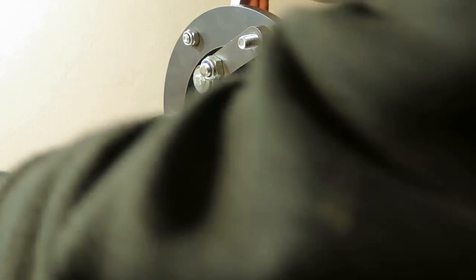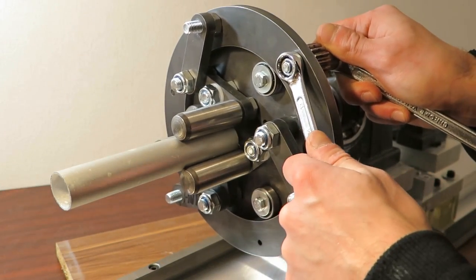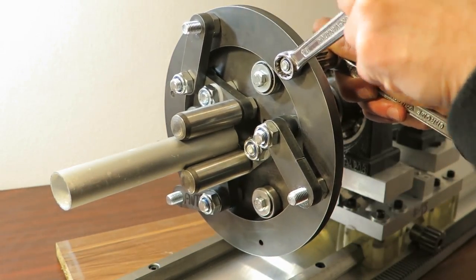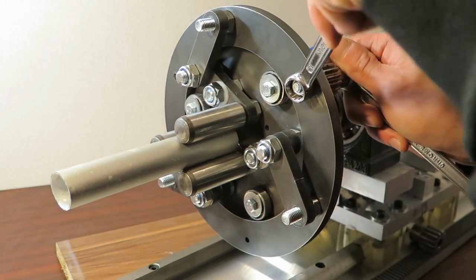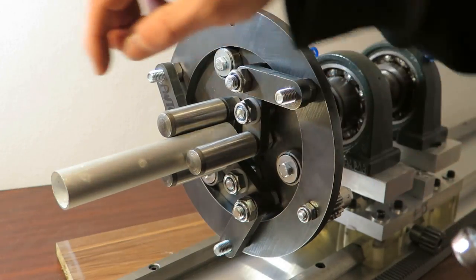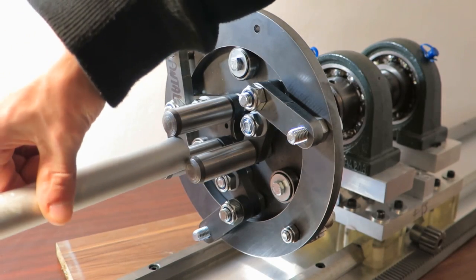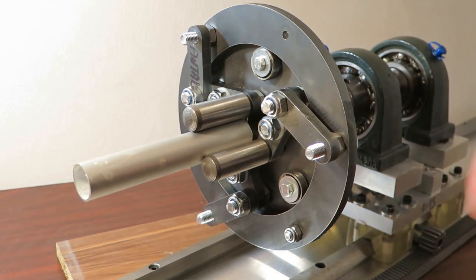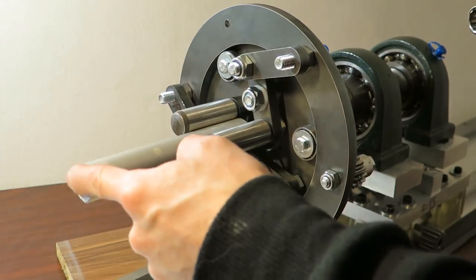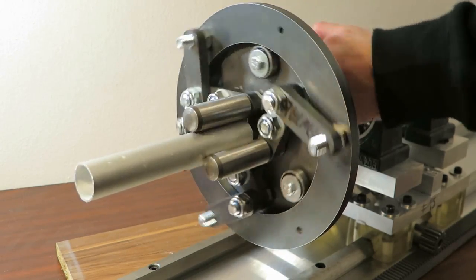So I'm holding this. Also, I'm not sure how I am going to retain this in locked position, but there's this nut, and am I unscrewing it? Yes. So I was thinking about this, that I will tighten this down and it's there pretty solid basically. Some silicone coating on these pins will be absolutely good. But yeah, I'm quite happy with this.